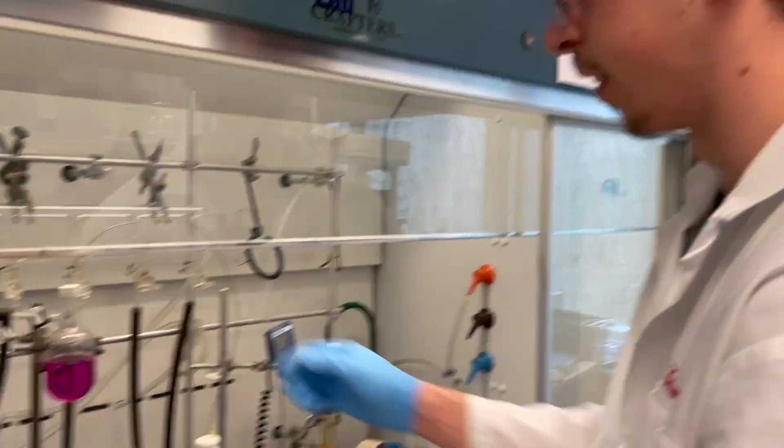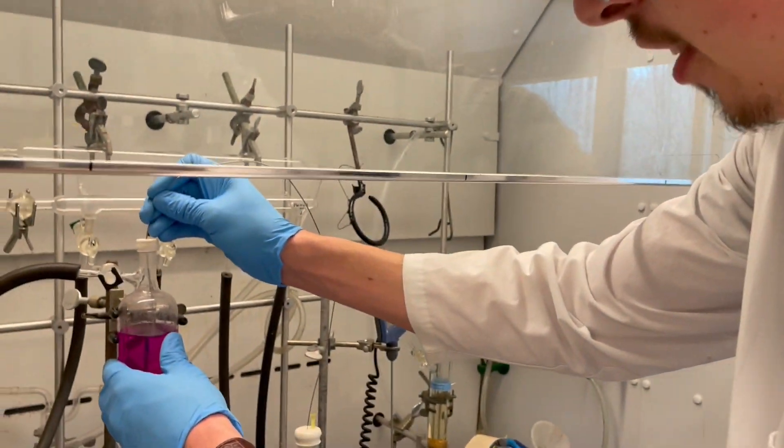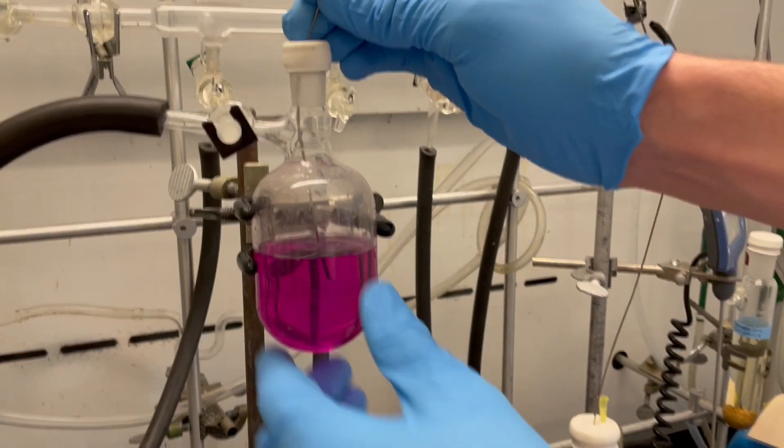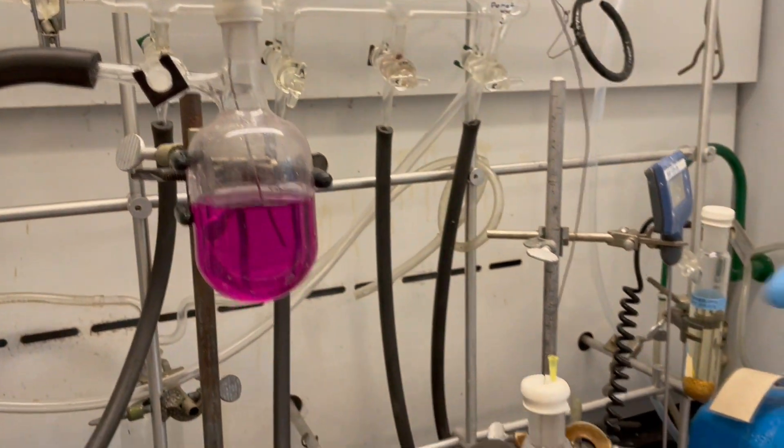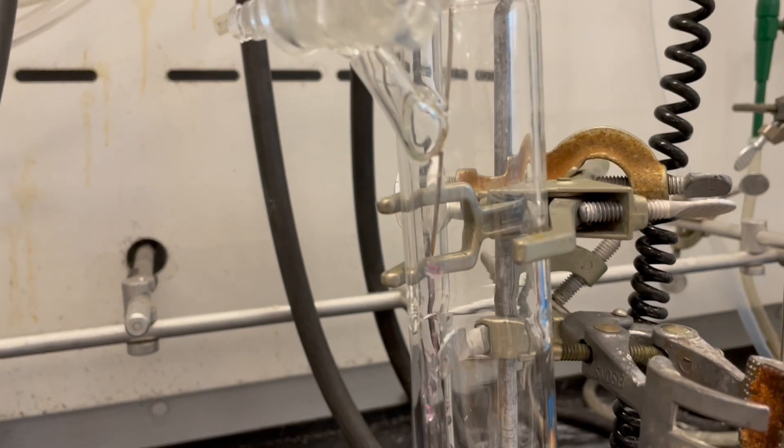Now we're ready for our transfer. Go ahead and insert the needle into the liquid. As you can see, it's already started to flow through.